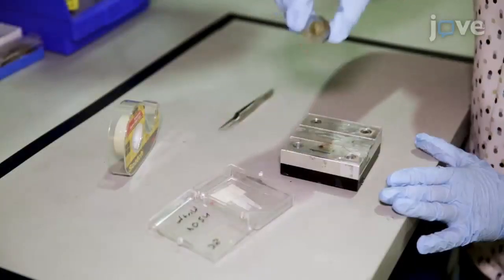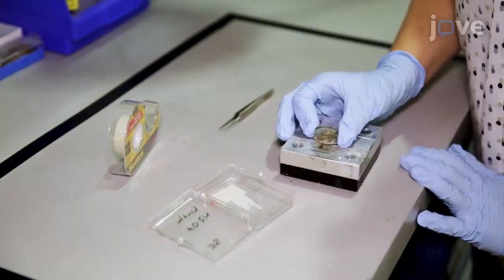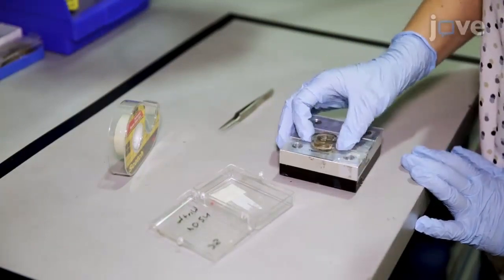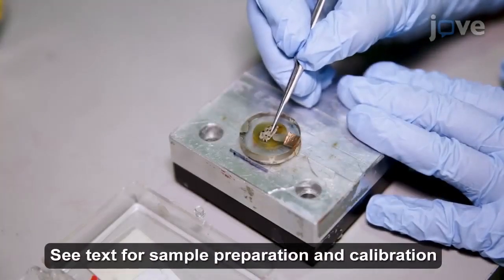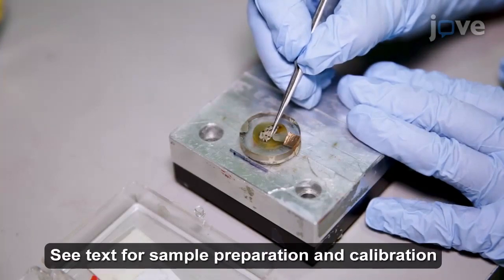To begin, attach a crystalline sample to the top half of a kinematic base so that the region of interest is vertically displaced relative to the base by at least 15 mm.